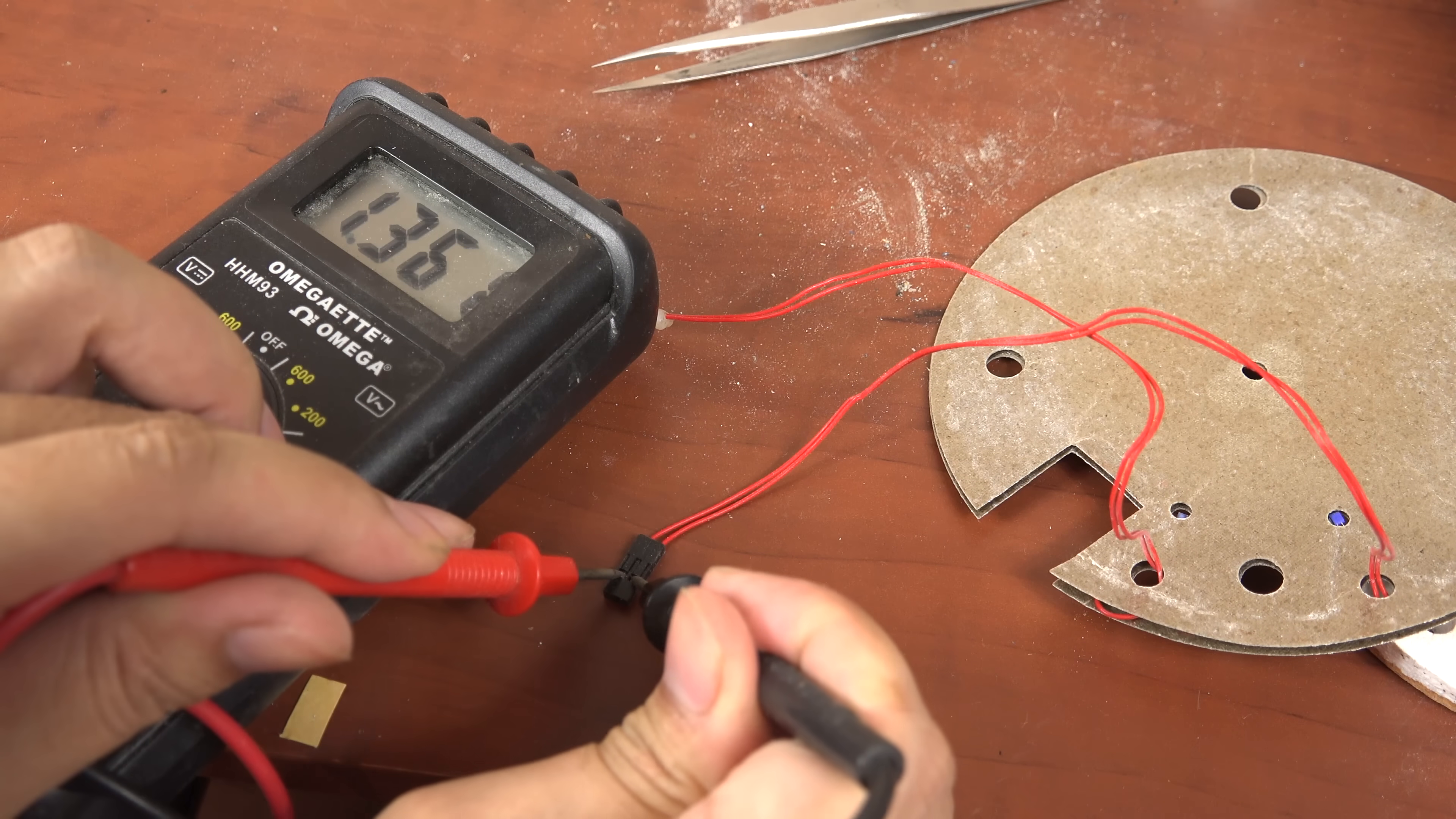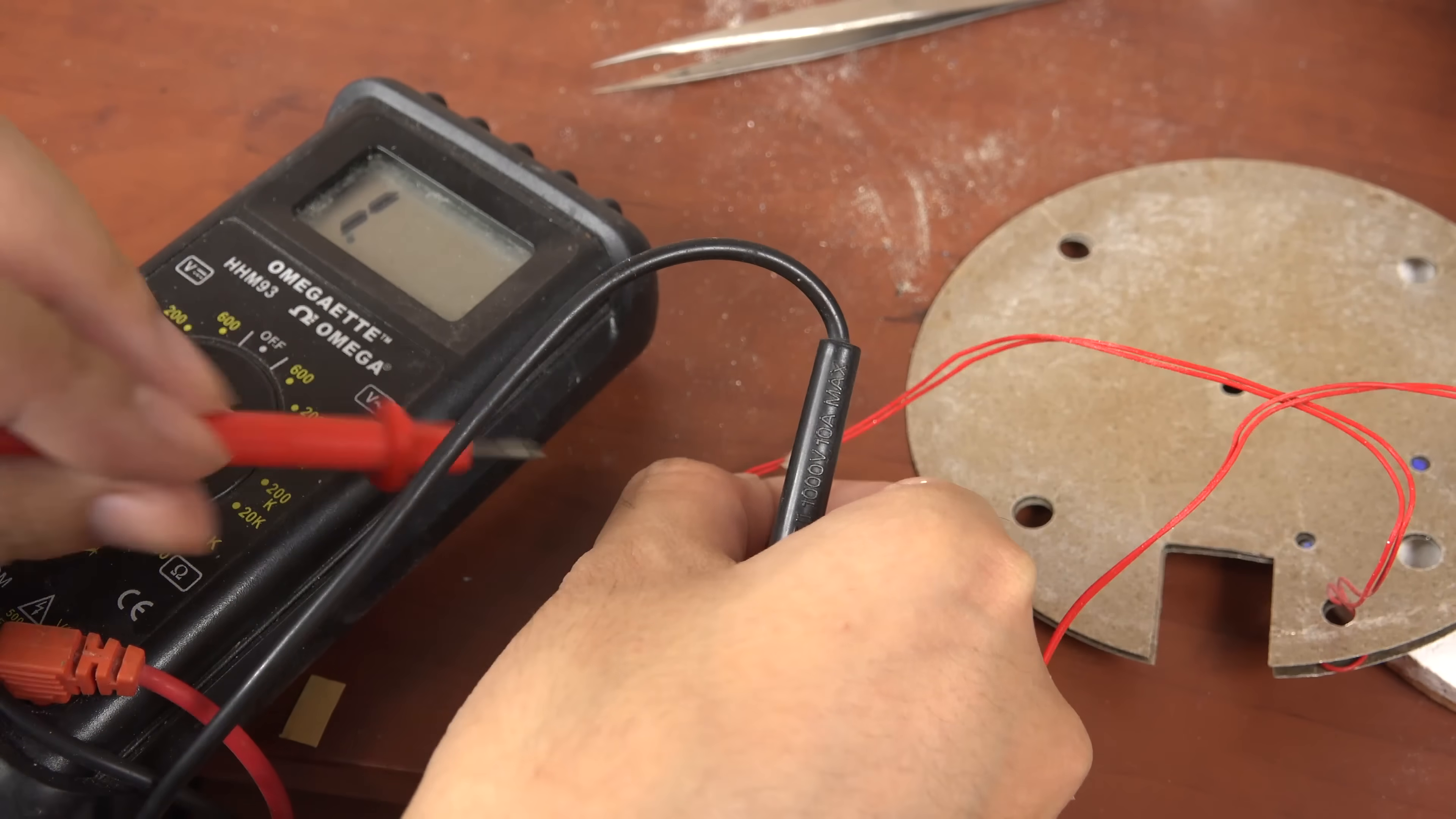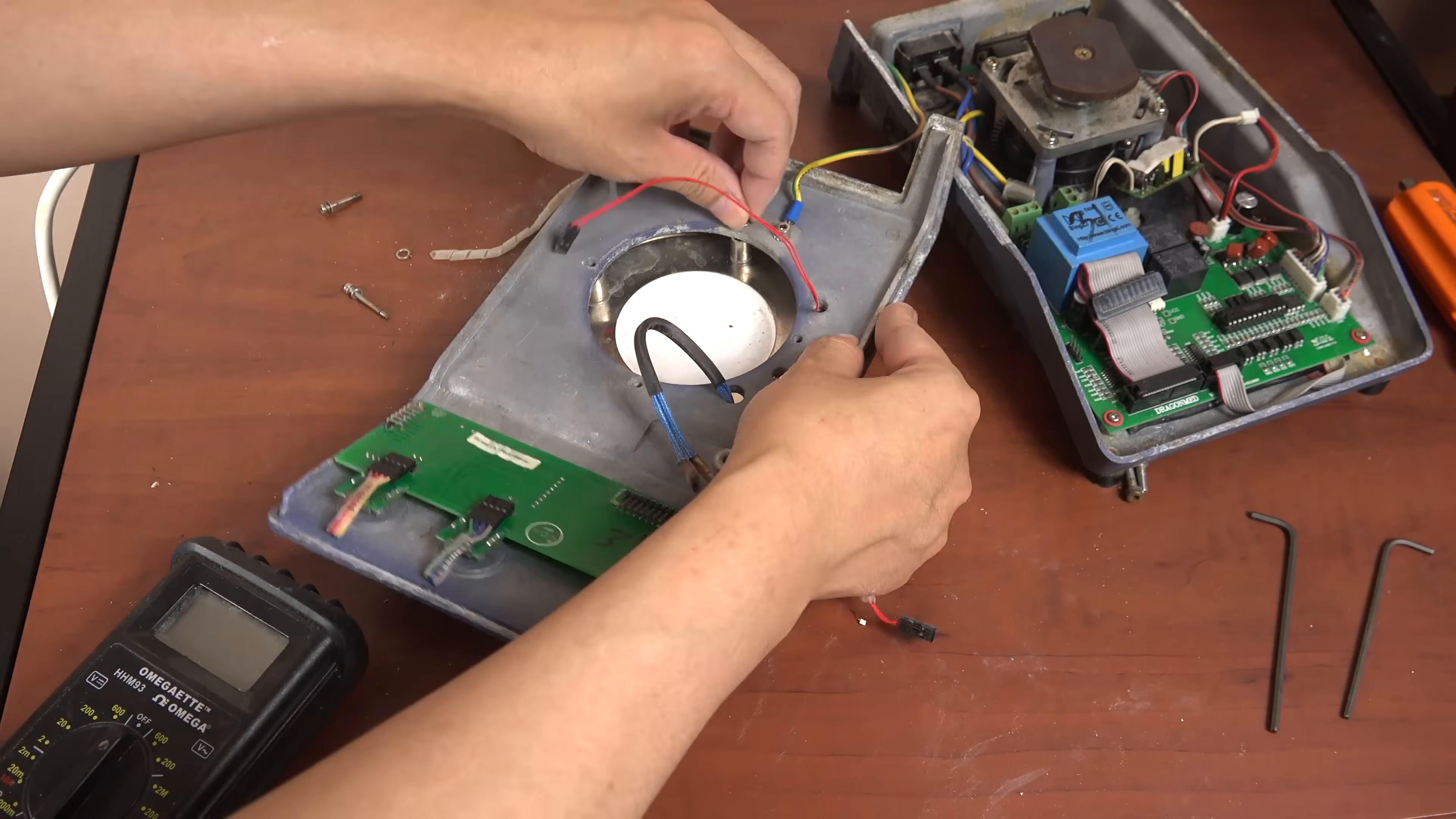Here I am testing sensors. The repaired sensor looks good so this should work. I'm also checking the other sensor again to make sure I didn't accidentally break it when I was doing my crappy repair job. It seems they both work now, let me reassemble that back into the hot plate.